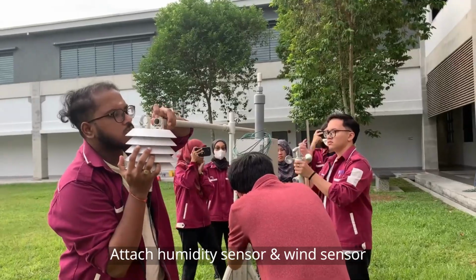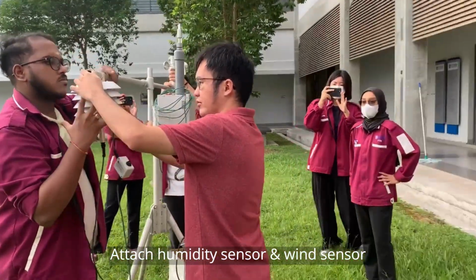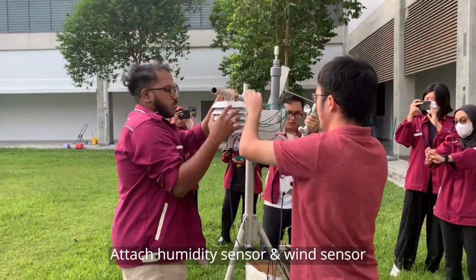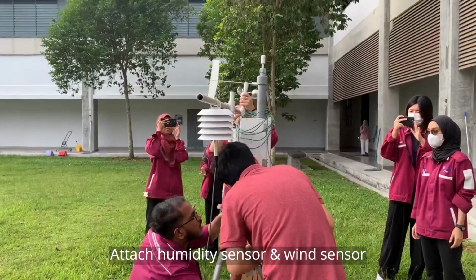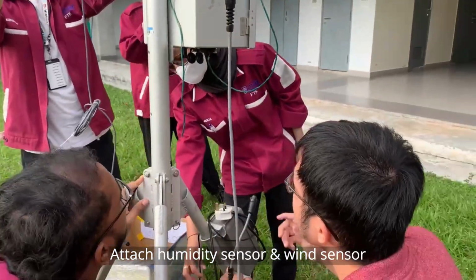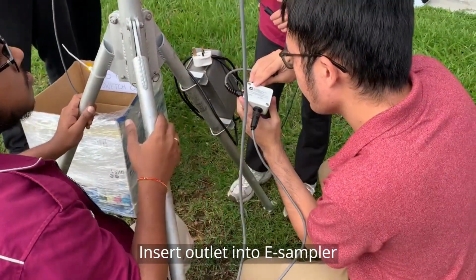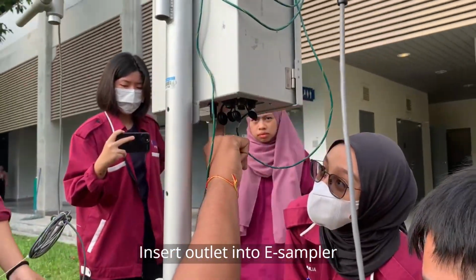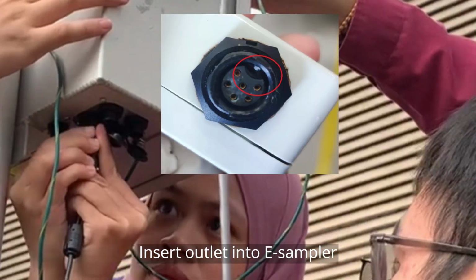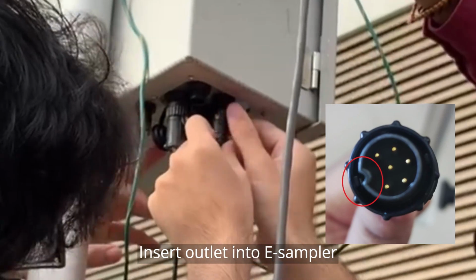Next, continue by attaching the humidity sensor and wind sensor on both sides of the e-sampler pole. Ensure to attach them carefully to avoid accidents such as broken parts during assembly. Then, the process continues with inserting the electric cord wire into the control device. Remember in this part to make sure the highlighted outlet is attached to the inlet by connecting them together.